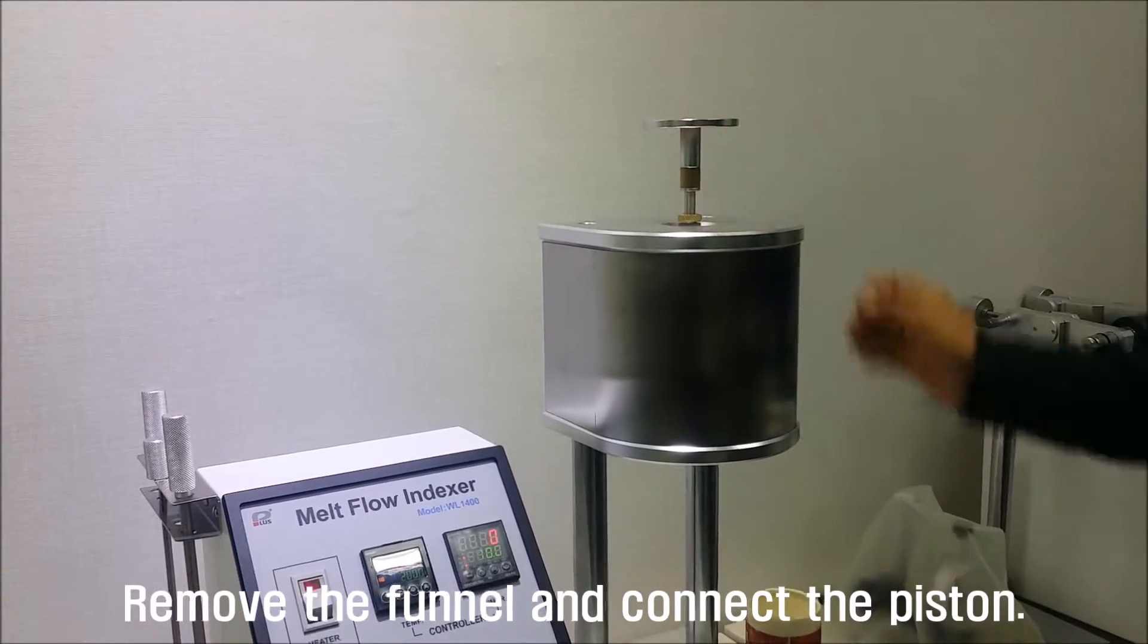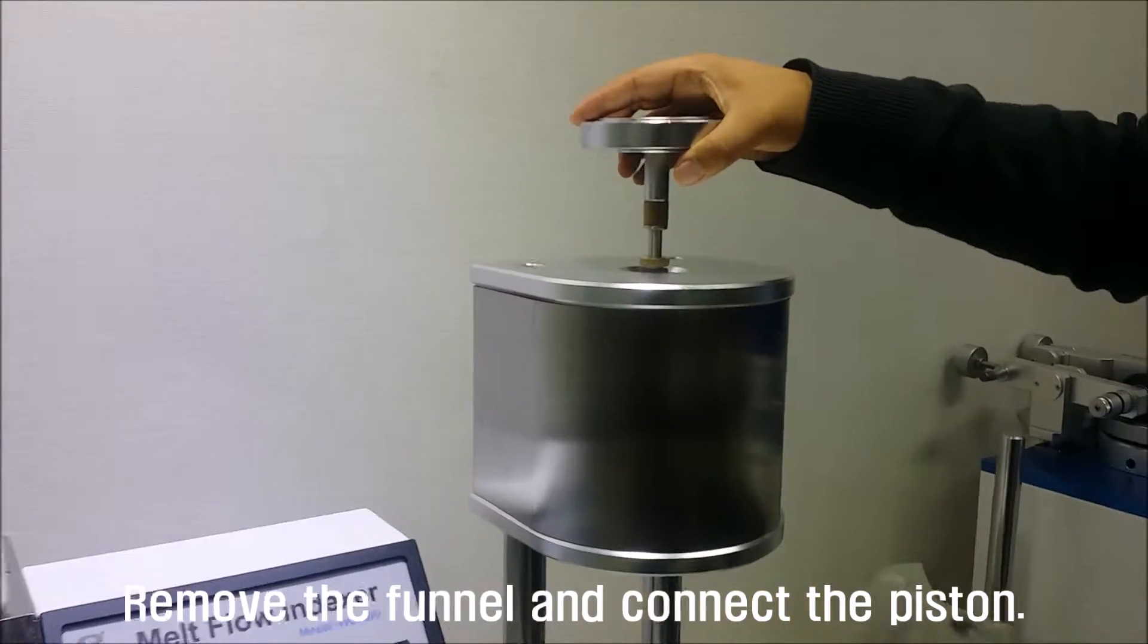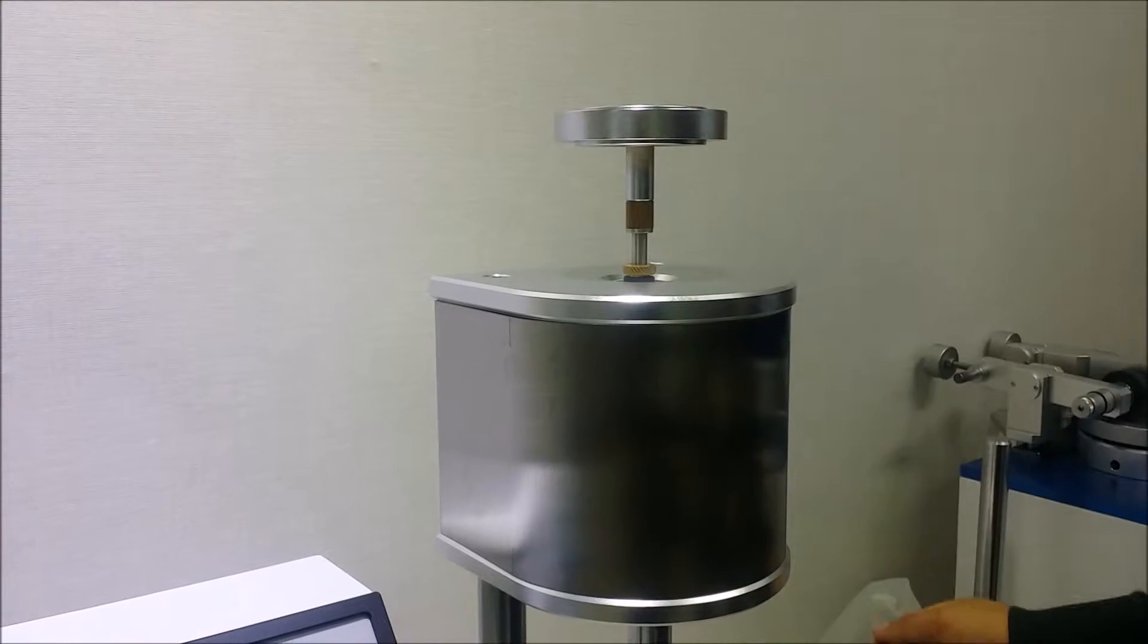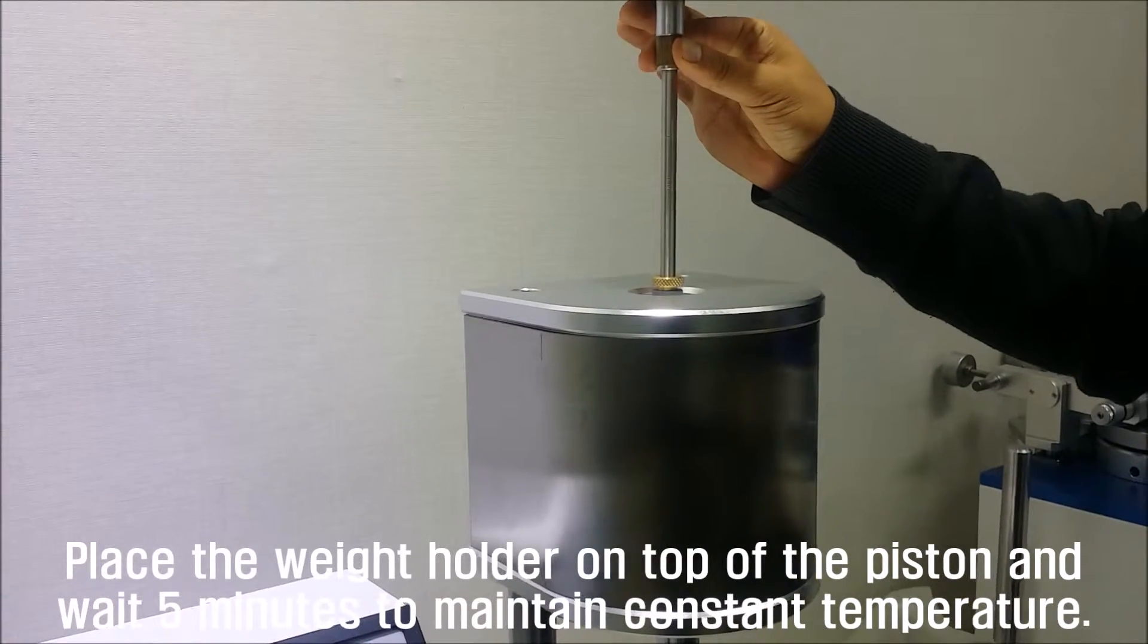Remove the funnel and connect the piston. Place the weight holder on top of the piston and wait 5 minutes to maintain constant temperature.